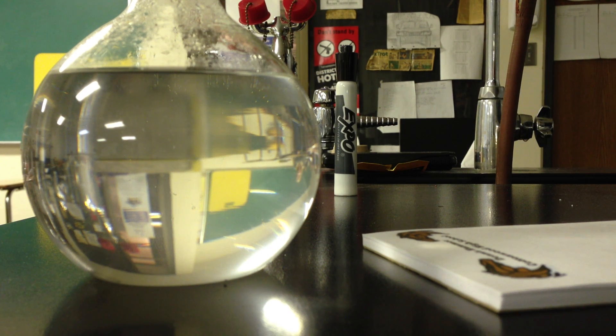And so I have a seed crystal here. And let's just add a little bit. It doesn't require very much. Just one tiny crystal. And I'm making a little bit of a mess here. We'll add that to my flask.